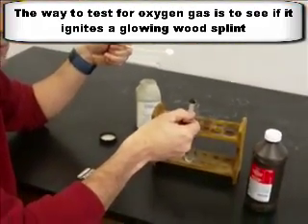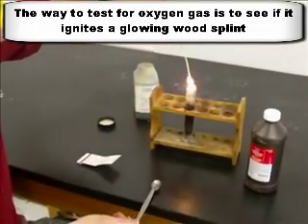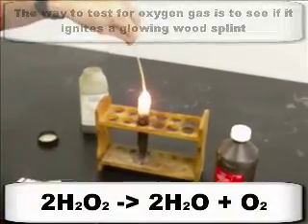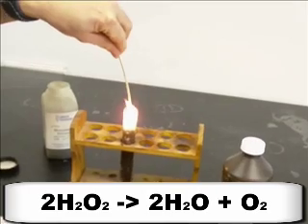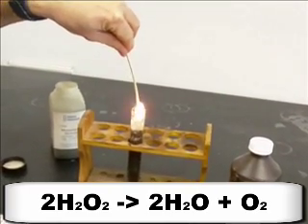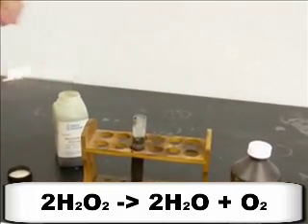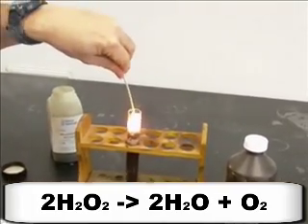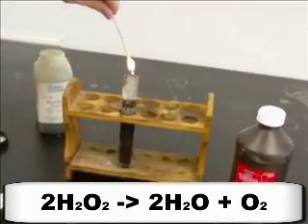So I'm going to add this. This should produce oxygen gas. And then watch what happens when I put this in here. See how it lights up much brighter? That's because we are producing O2 gas. See, it stays lit even when I put it in there because it's producing this oxygen gas. You can even blow it out and make it glow and put it back in there. It'll reignite. Hey, look at that. See how that's pretty cool. Should do it again, because it's producing the oxygen gas.